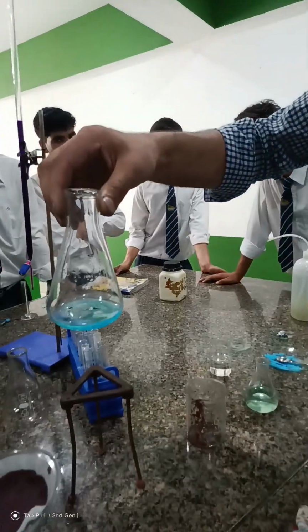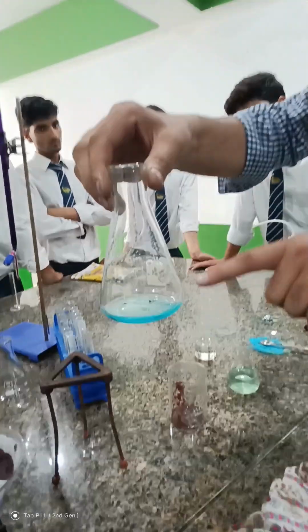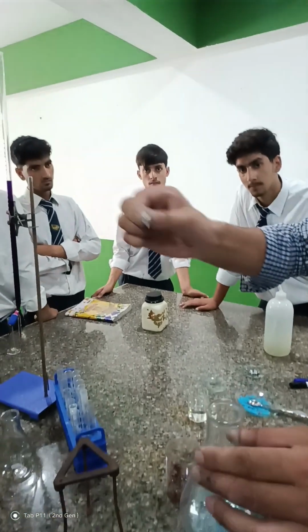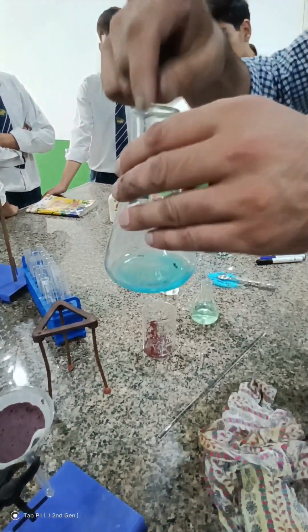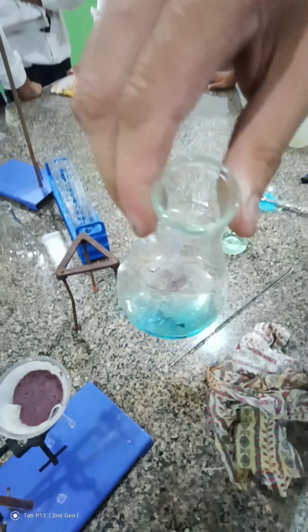You can see the color of these zinc granules will turn black. The zinc present on the surface of the granules undergoes the reaction. It was silver. I will show you one more. It is silver in color. If we insert it, its color will change to black. You can see it on these granules, the color is changing.